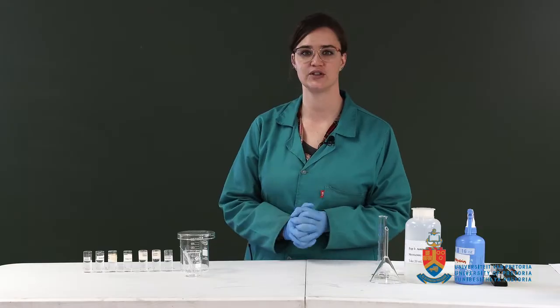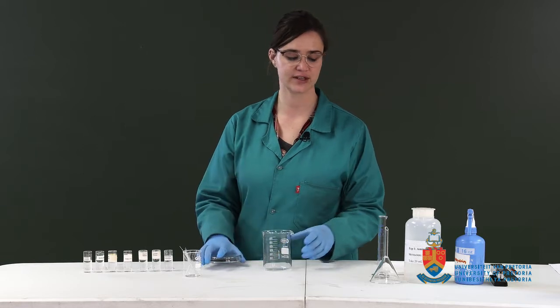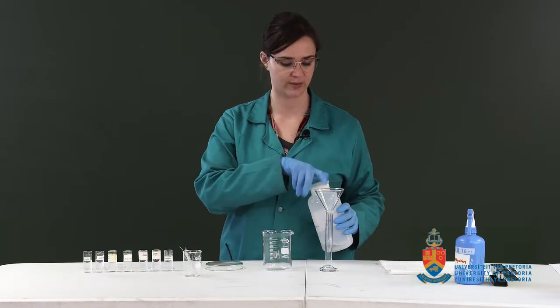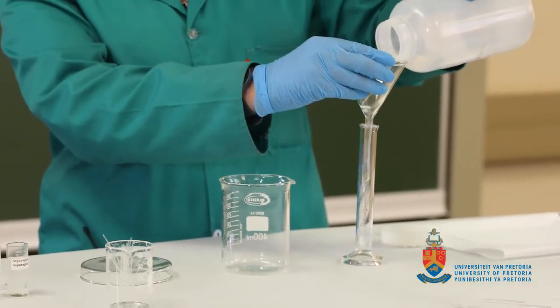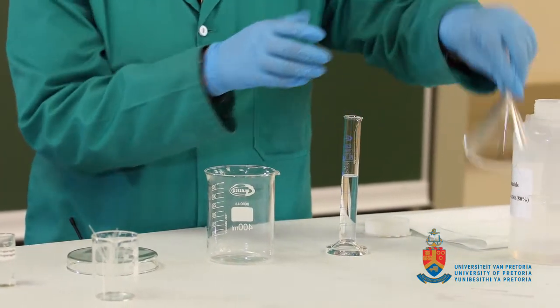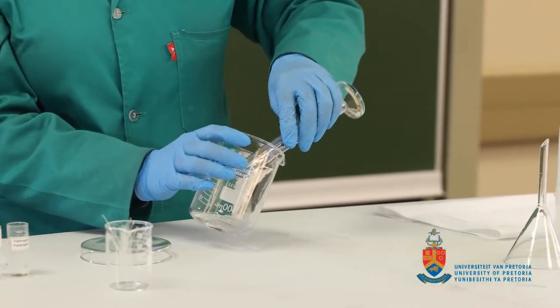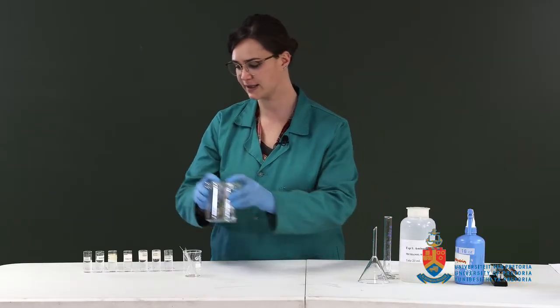So the first thing that you need to do is to put the eluent into your developing chamber. The reason this is the first step is because you want the atmosphere in the developing chamber to be saturated by the time that you develop your chromatogram. So about 20 milliliters. It's an estimate, so we don't need to be too accurate. Of our eluent, that is a methanol water mixture. Pour that into your developing chamber, cover with the lid, and just set aside while you do the rest of your preparation.